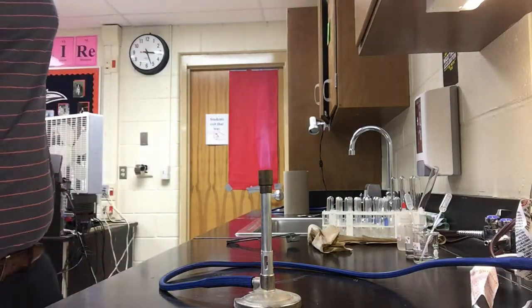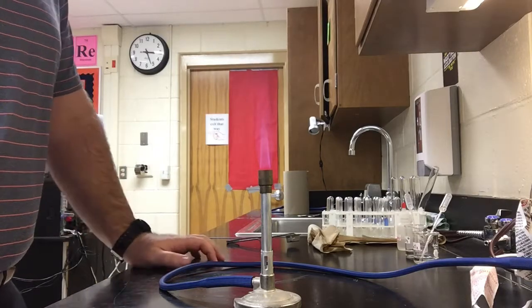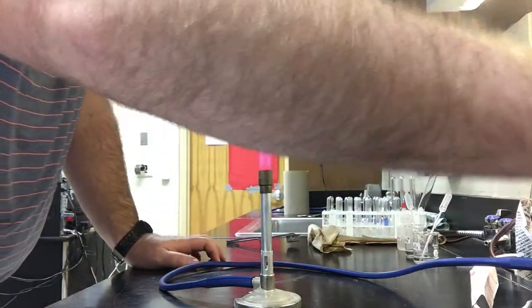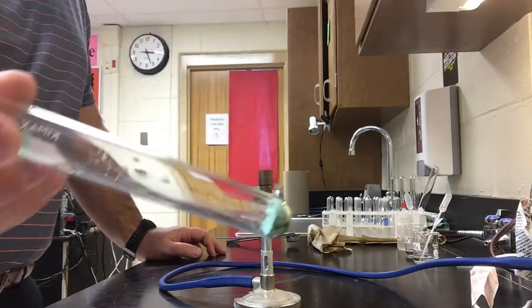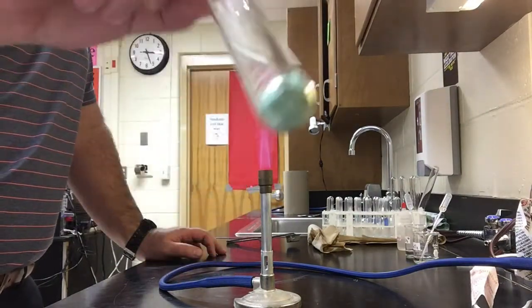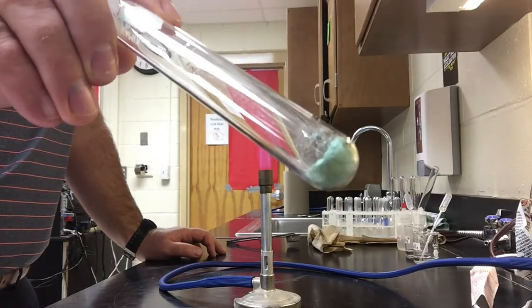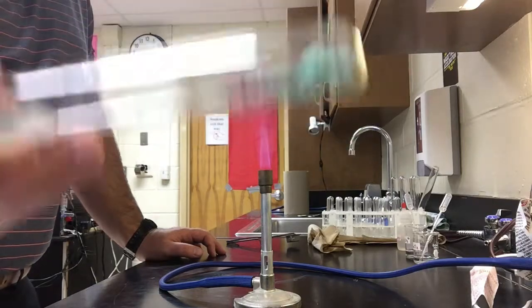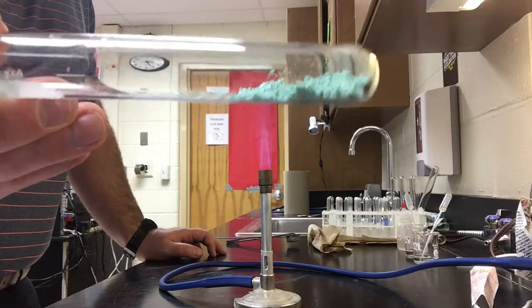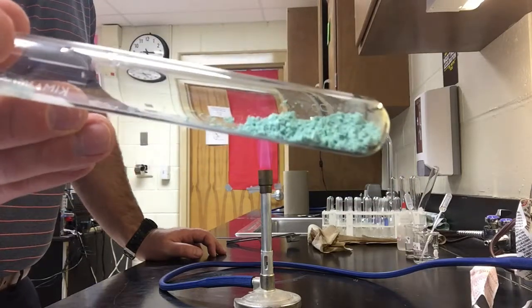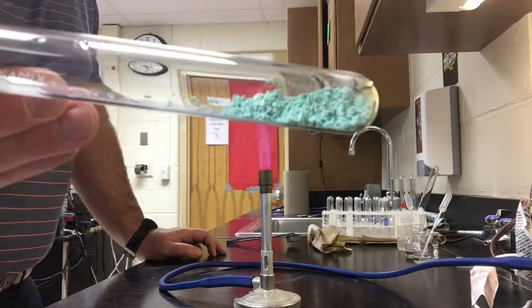Okay, so reaction A is a decomposition reaction and it involves copper carbonate. I've got some copper carbonate here in the test tube. I'll let you take a look at it. Observe the color, maybe the state of matter it's in, and give any kind of physical descriptions that you possibly can. Again, this is copper carbonate.